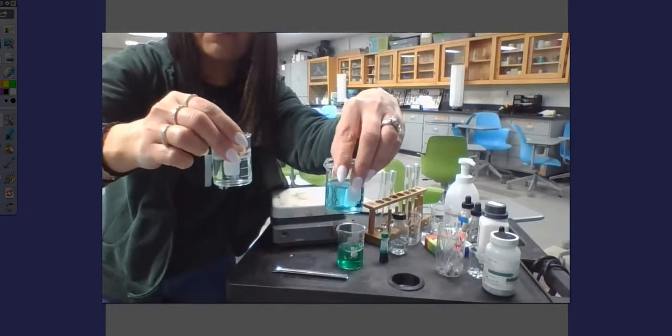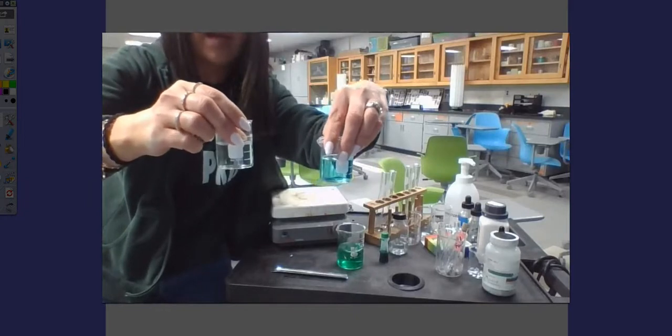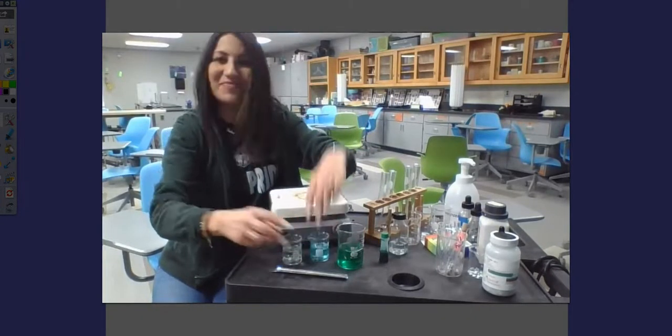This one is still lighter than it was before, but we still have quite a bit of that blue color that's inside of there. All right. Happy day.